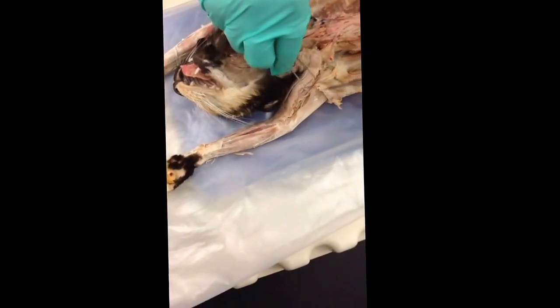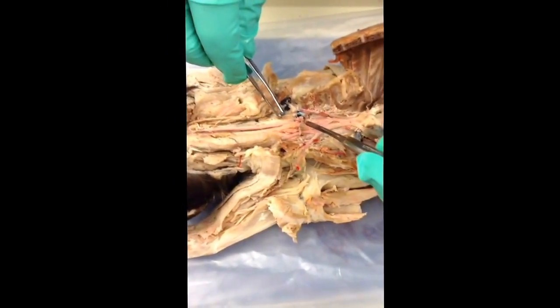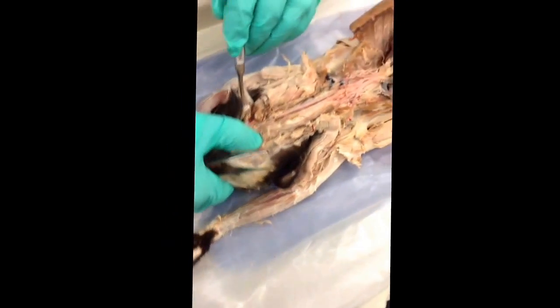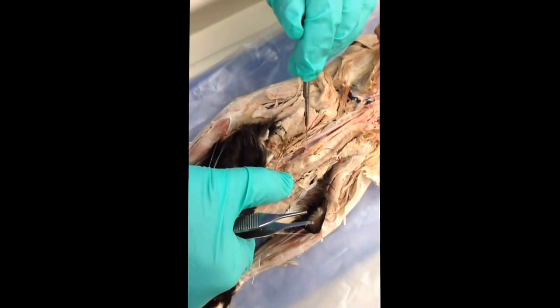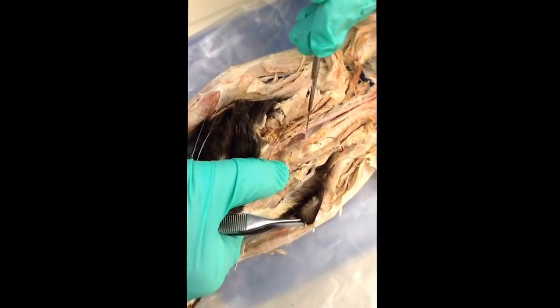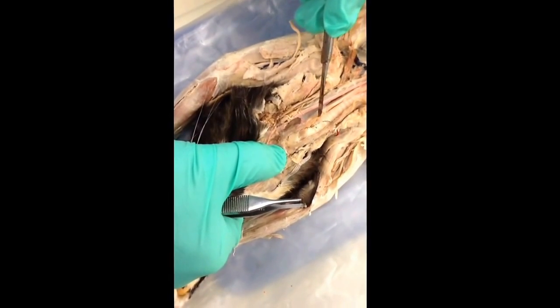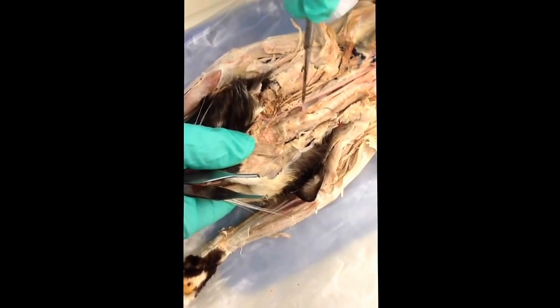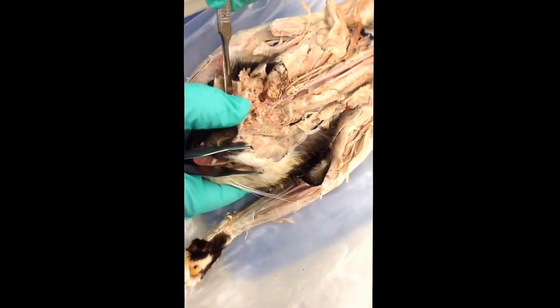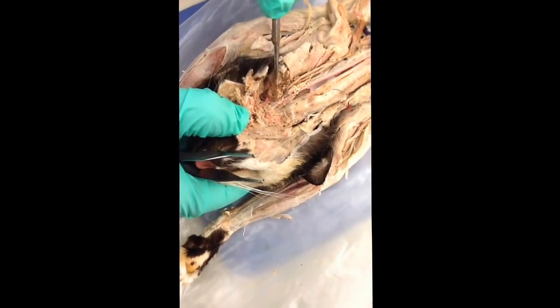Now let's retract. Let's go back up and follow the left common carotid. The left common carotid comes up, and off of the left common carotid there is the superior thyroid. Again, it is a small artery, but it delivers a lot of blood to the thyroid gland per minute. All right, this left common carotid comes up, and there is, as B.L. Allen indicates, like a curve in the road.